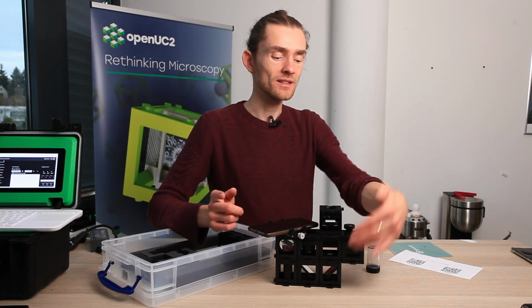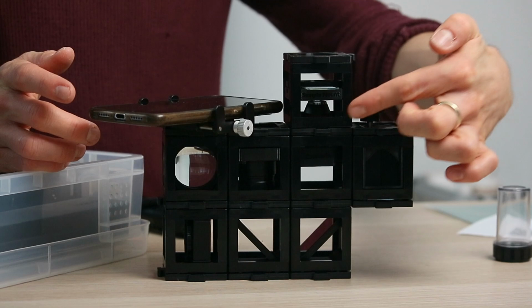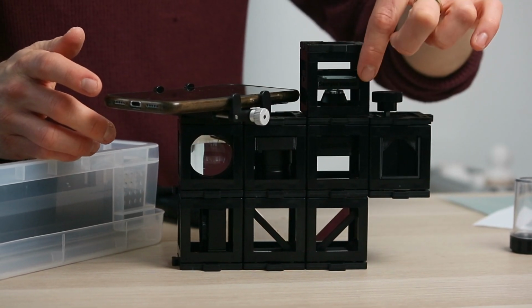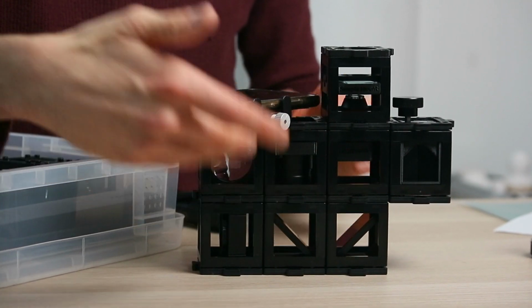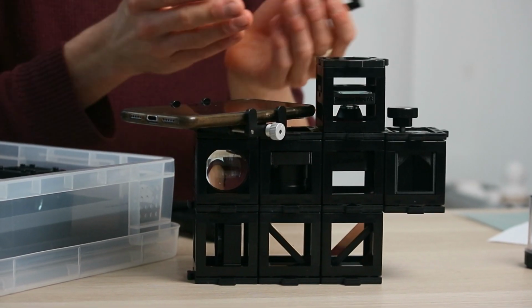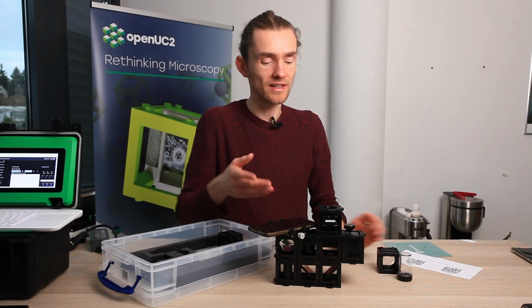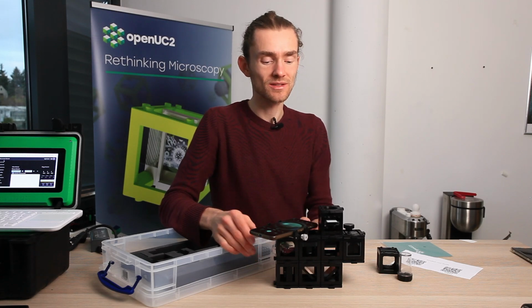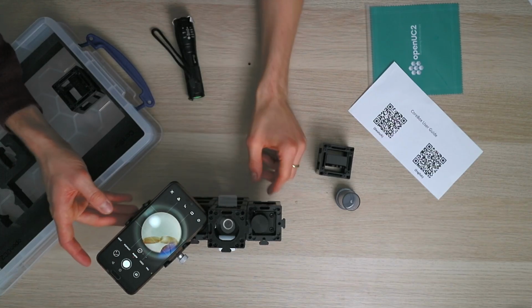And so there are two different paradigms in microscopy. This here is a microscope with a finite corrected objective lens. So the situation is slightly different because this lens here will form a real or like an intermediate image somewhere here, where in infinity corrected microscopes, the sample is brought to infinity. So that means the rays between this plane and that plane are just, well, infinite. So that means parallel. And then the lens here will just form, again, an image similar to what we have seen with the lens. So light comes from infinity and then focus that on the screen, or in that case on the camera. And so the lens from the cell phone again, or also your eye, will image everything that comes from roughly infinity on the retina or the sensor, and that's why we see the image here.